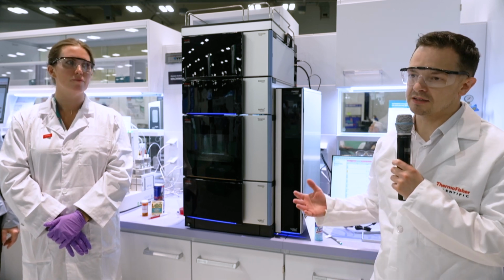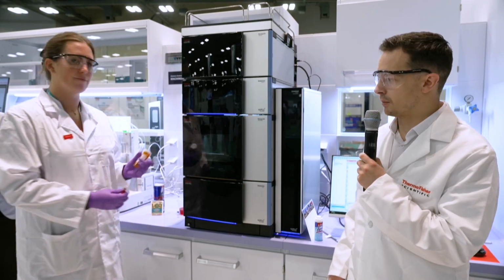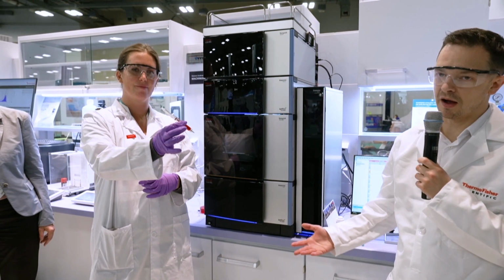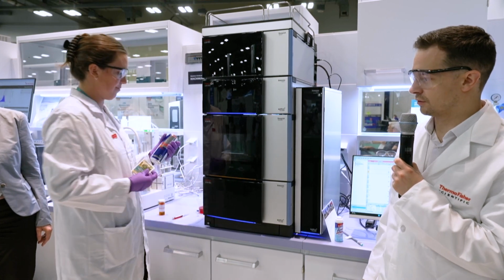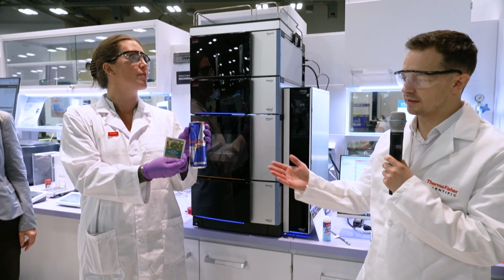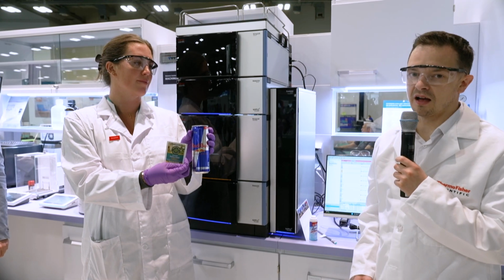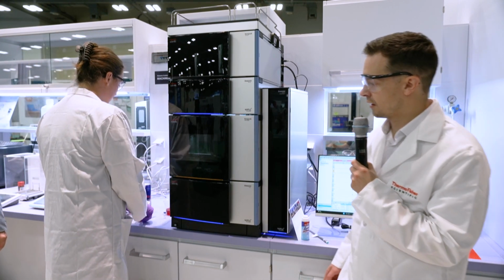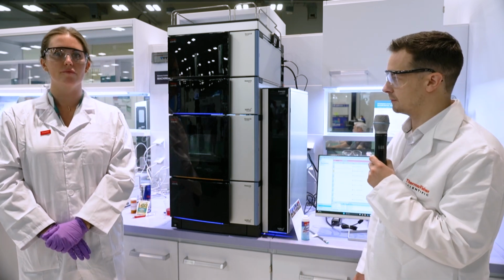Generally speaking, you'll find charged aerosol detection across all forms of industry. So from pharmaceutical analysis, like looking at impurities and drug profiling, to biopharma analysis, and then moving to, say, natural products and food and beverage. So with drink analysis, we can look at all the additives that are in there, as well as the sugar content and the caffeine content. And then you'll also find it in various labs, such as environmental labs.